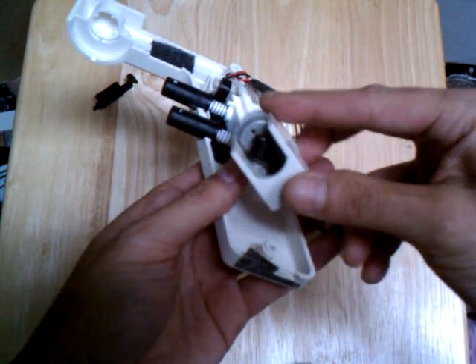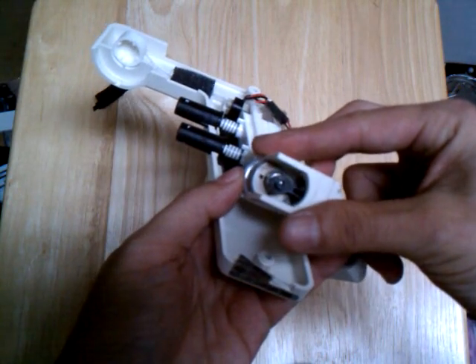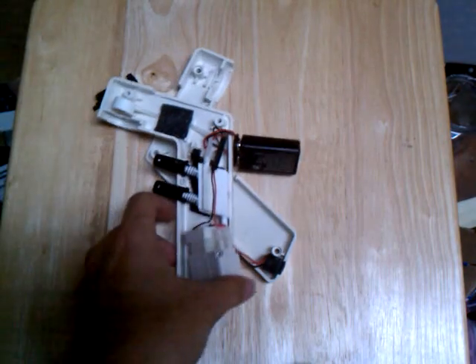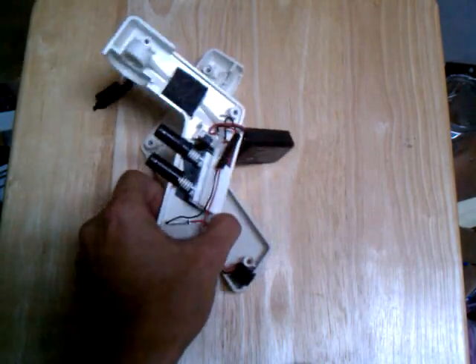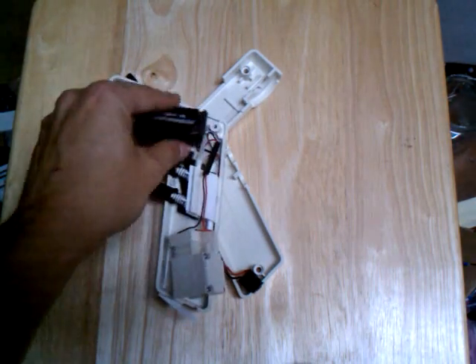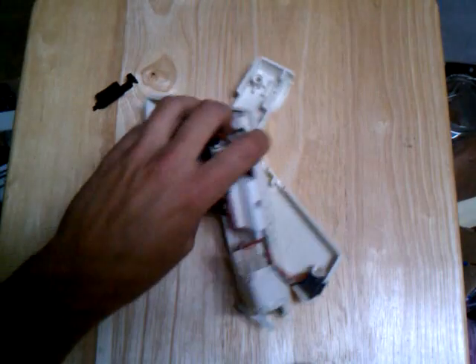That's got a killer app somewhere — already really made, bolted onto a motor, probably a very common shaft size. Great things in junk equipment. You know, if you're a biotech geek, you work in a biotech setting — just one of those cool things. Getting lots of little bits out of there from the pipette aid.